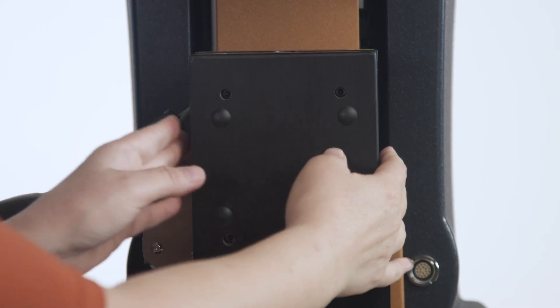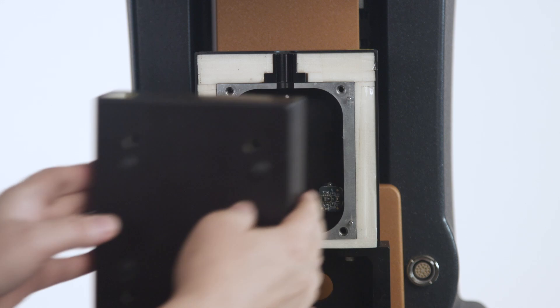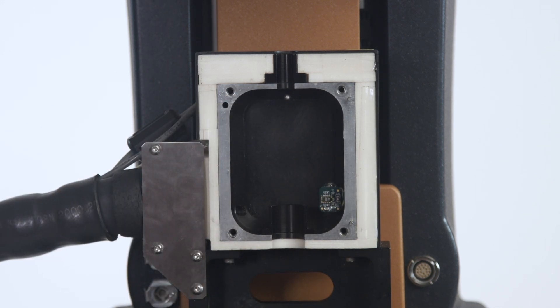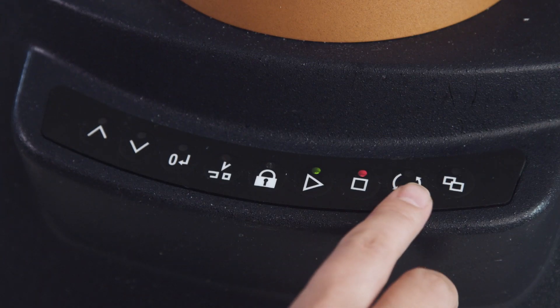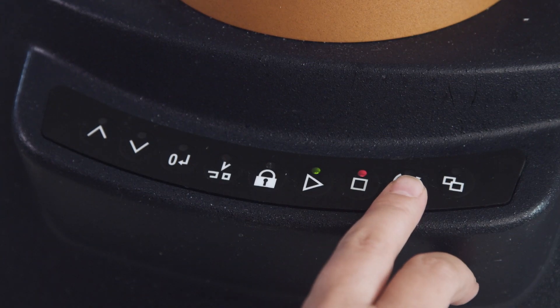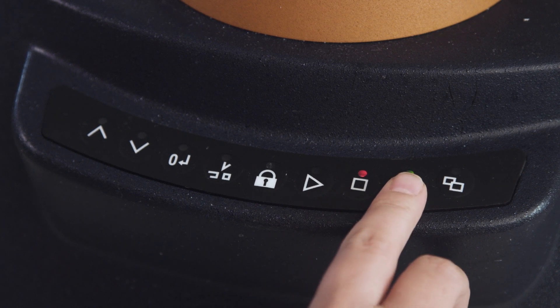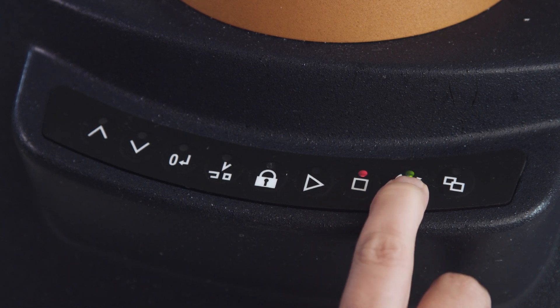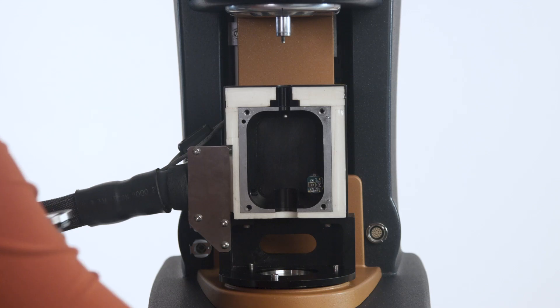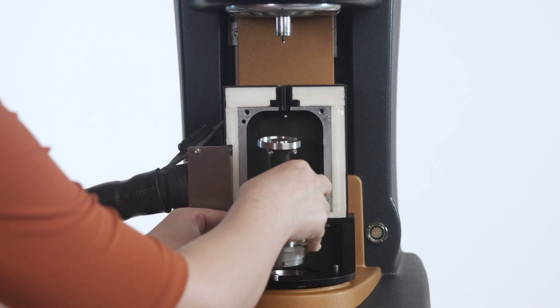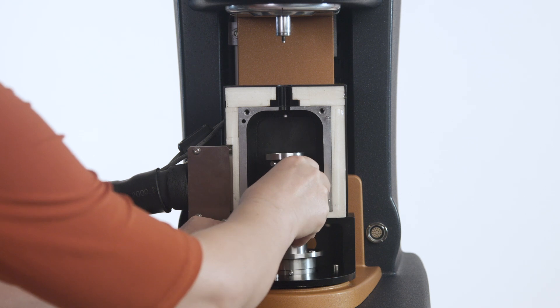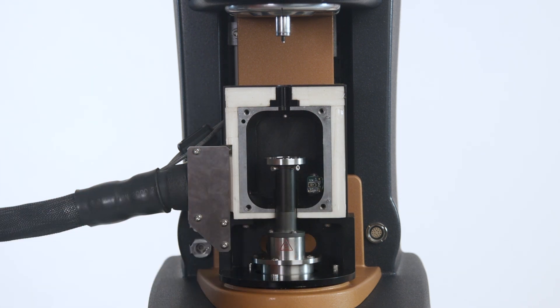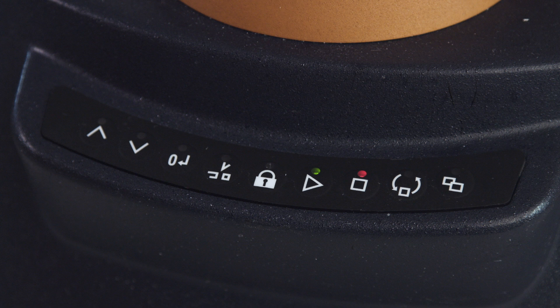Remove the front face of the humidity chamber. Press the release button on the instrument keypad until you see a continuous green light. Insert the bottom geometry stage. When the green light is turned off, the bottom geometry stage should be locked in position.